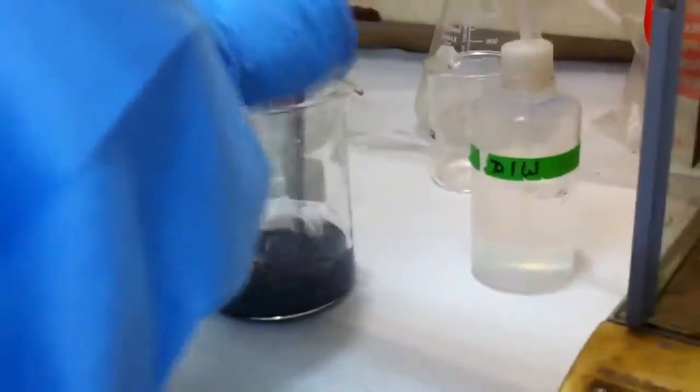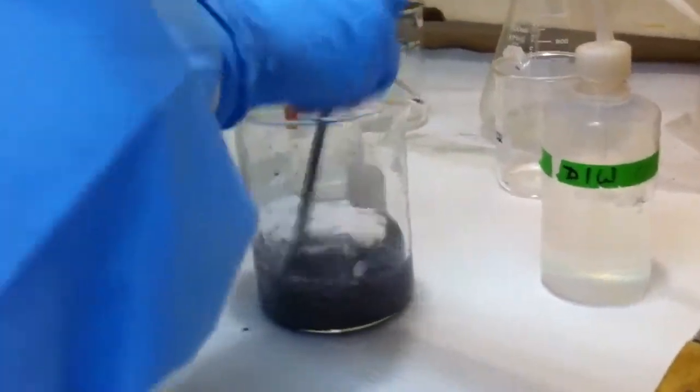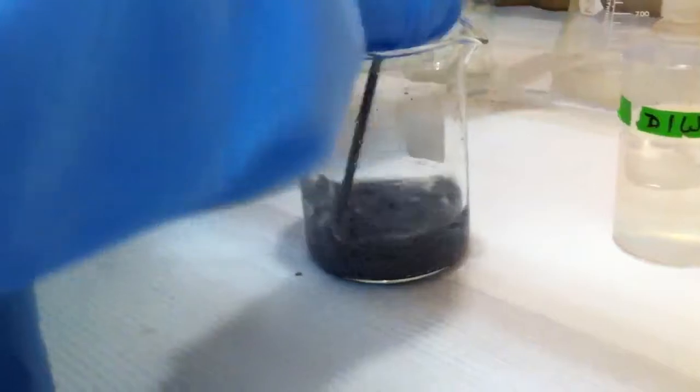So now what we do is we rinse the heck out of it, because we want the pH to be back to about neutral.